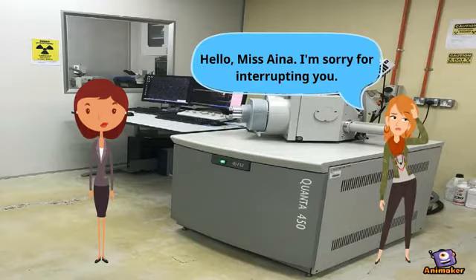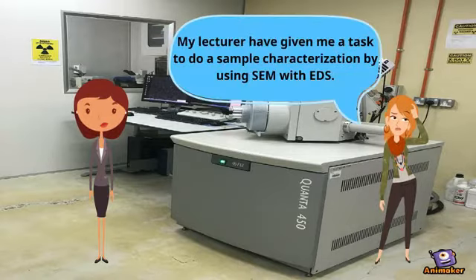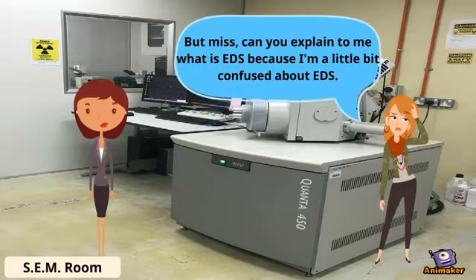Hello, Miss Aina. I'm sorry for interrupting you. My lecturer has given me a task to do a sample characterization by using SEM with EDS. But Miss, can you explain to me what EDS is because I'm a little bit confused about it?